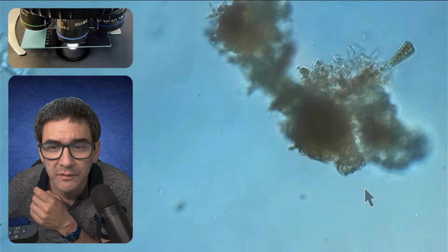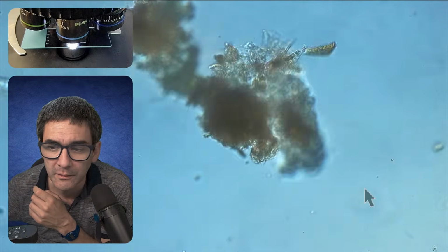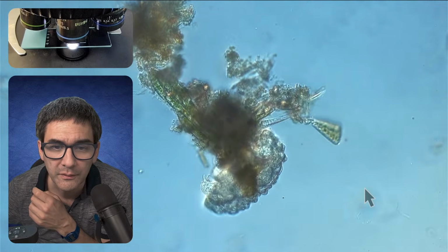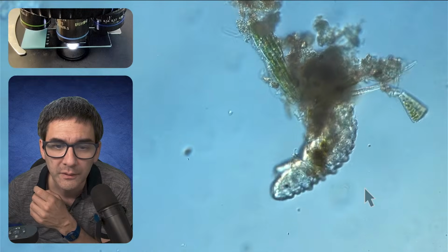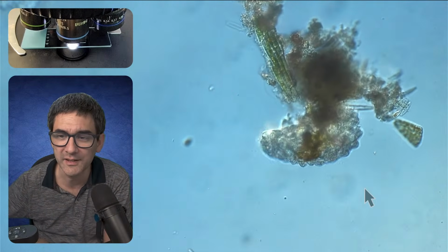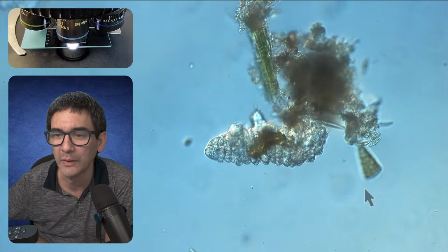And 40 times. So here we go. Yep, so that's basically a little surprise. That's the tardigrade.